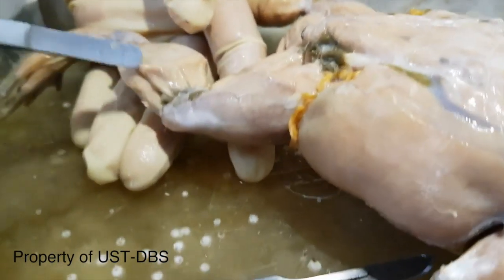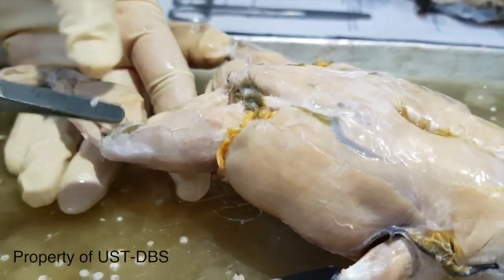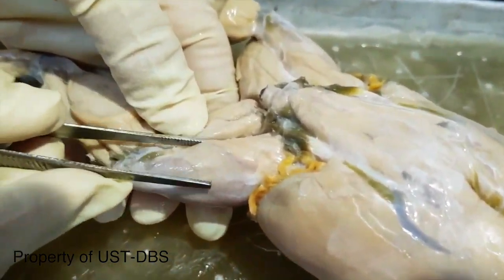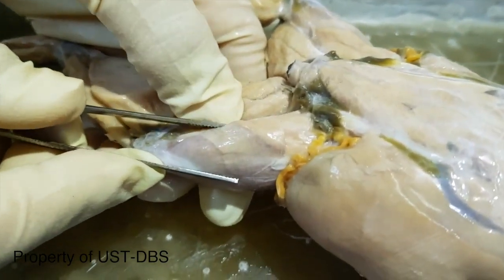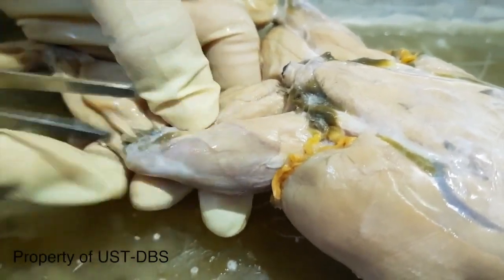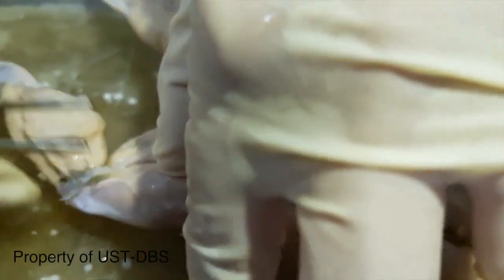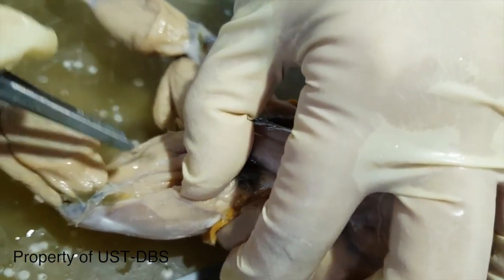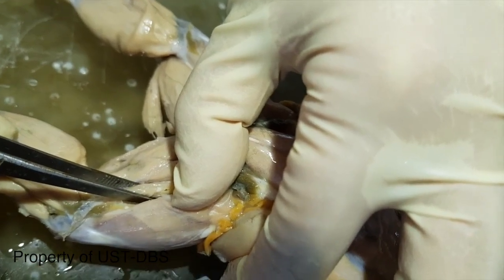Okay, so dorsal side muscles of the limbs. The big one here for the thigh: this one big muscle, which supposedly has three origins, is the triceps femoris. Then if you deflect that and put it on the side, you will see a small muscle in here. That's the biceps femoris.